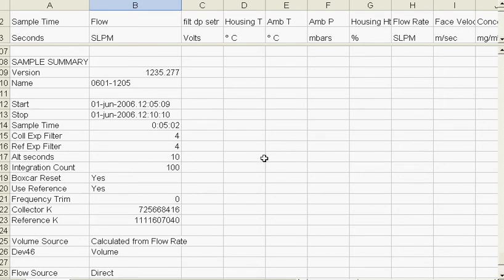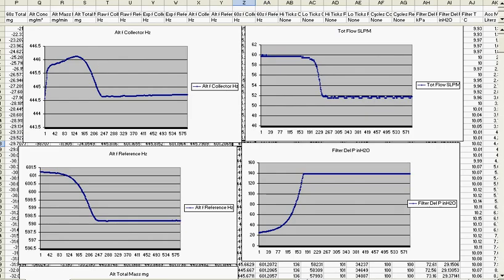Now I'm going to show you another sensor and how a bad sensor works. This is a bad sensor. It's known as 0303. And what we show here is the alt collector. The collector resonant frequency goes up instead of going down. So what's happening here is with the smallest amount of collection of particulate, the filter's getting closer and closer to the filter holder, showing that the mass is decreasing because the lever arm is decreasing. And then at this point here, the filter starts to seat fully, and we have a monotonic increase in mass.